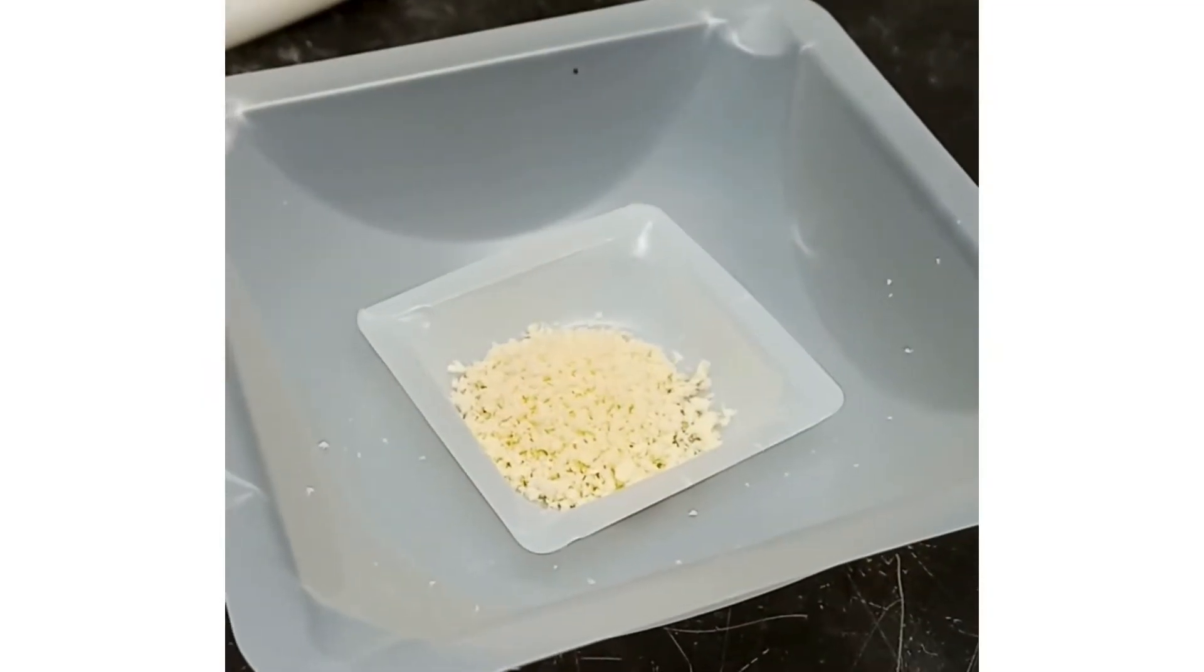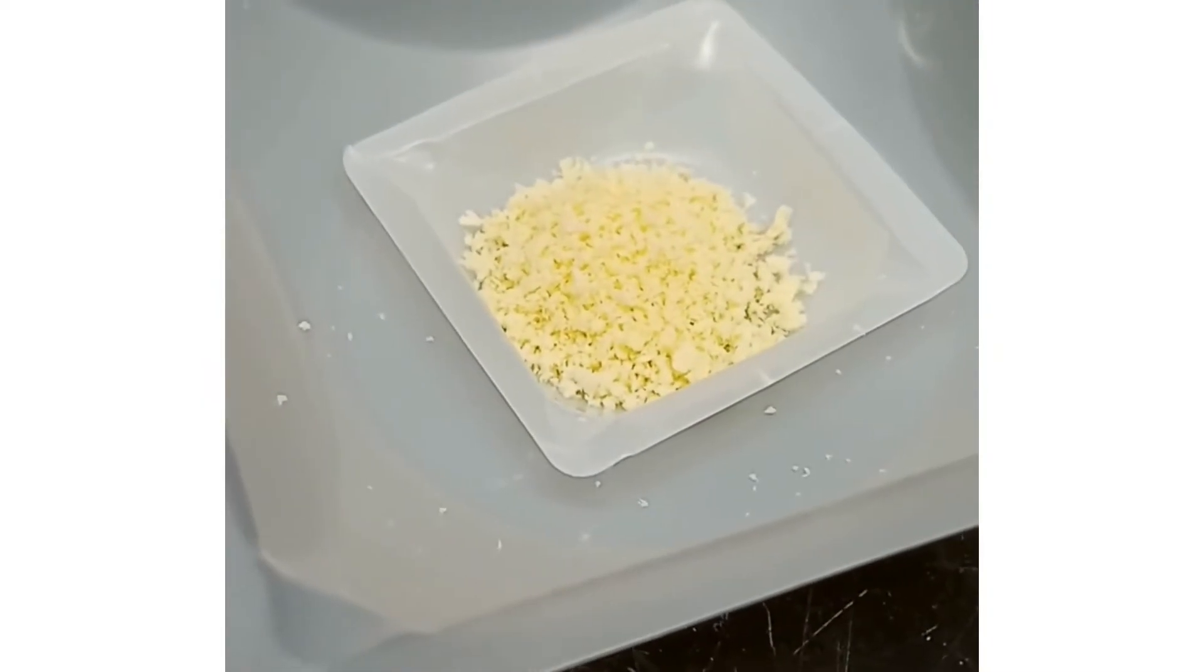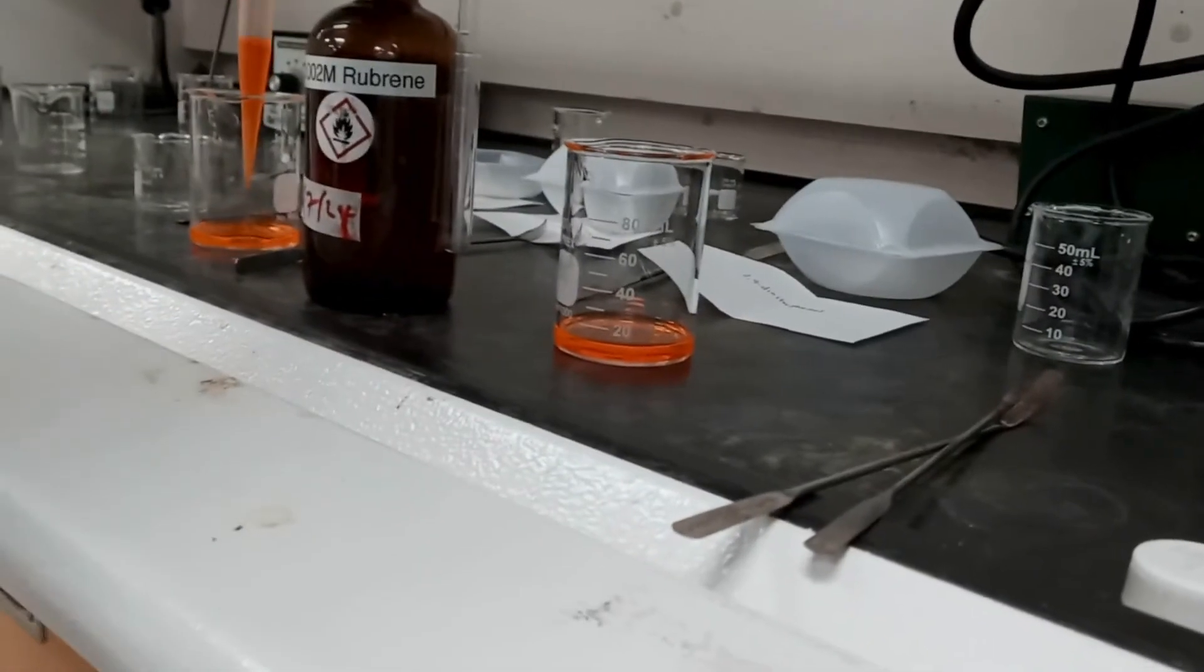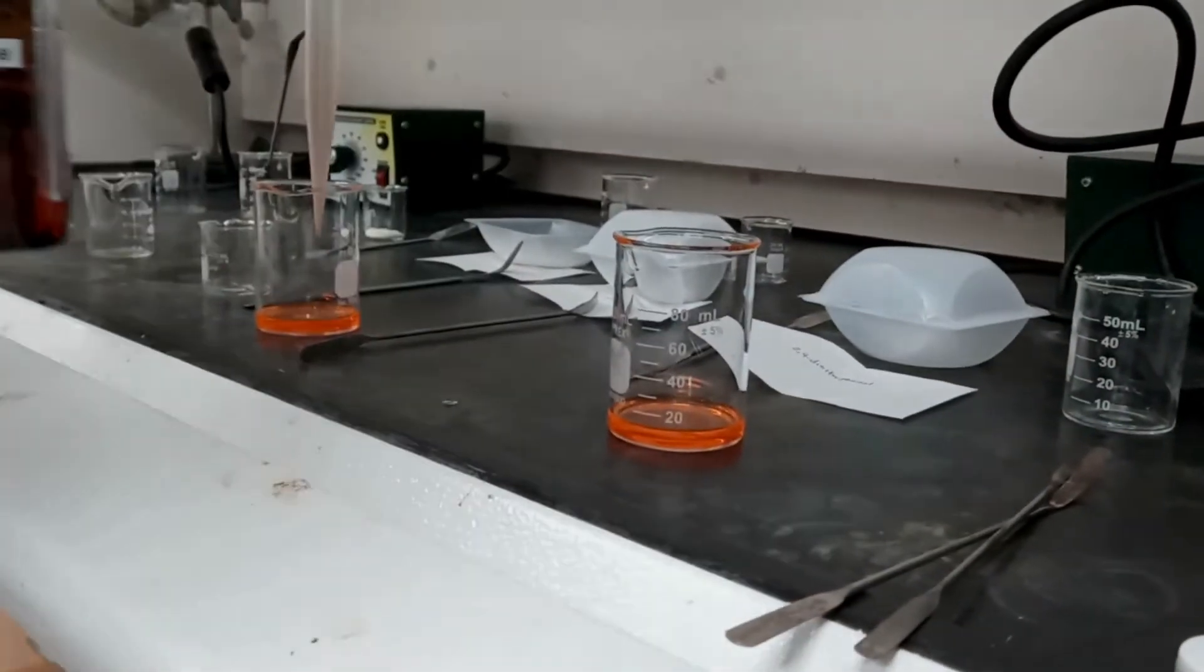We followed up with the rotovap and again ended up with the yellow powder. However, this time we made our ester. This was the last thing we needed to make and now what we've all been waiting for.